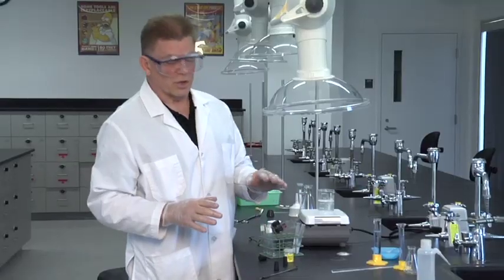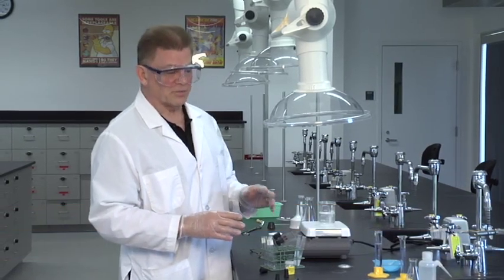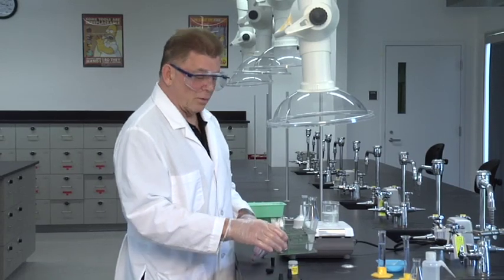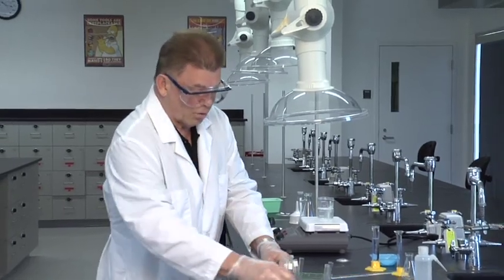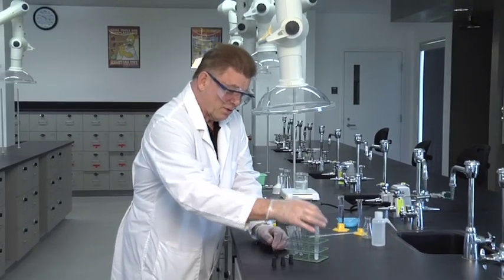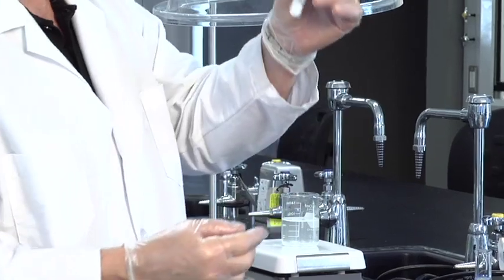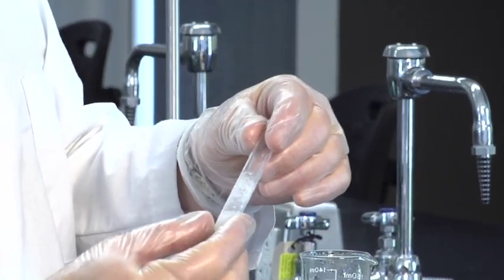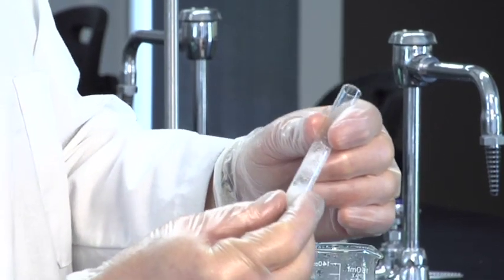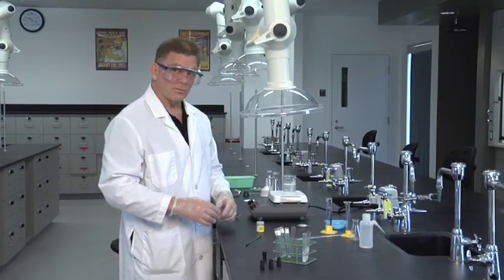What we're going to do is perform this recrystallization of benzoic acid on a larger scale — on a 1 gram scale — and we'll use boiling water. This is a good experiment when you're just learning the technique. So water will be a good recrystallization solvent. What's wrong with the cyclohexane? Cyclohexane is not bad, but when you put it into ice to force more crystallization, the cyclohexane freezes above the freezing temperature of water, so the whole thing turns into an ice cube. So cyclohexane is not that great because the whole thing solidifies.